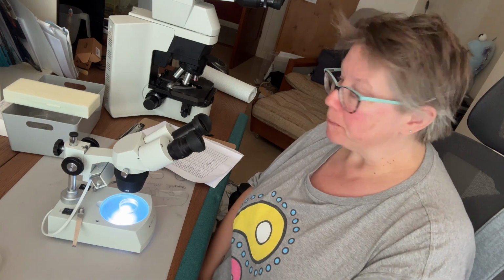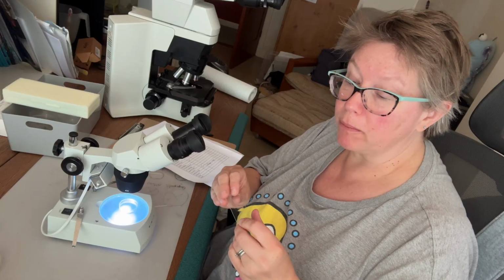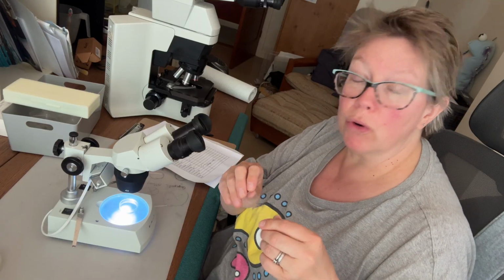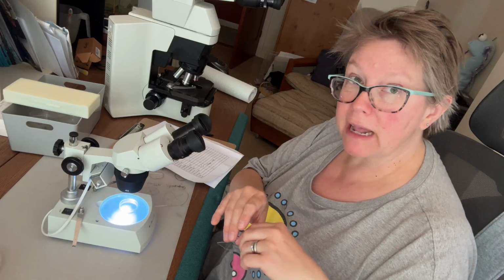If you have a higher powered microscope, you might choose to select some organisms or perhaps just a random sample from your petri dish. Pop them on a slide. So for the larger zooplankton, I suggest using a well slide or a concave slide. And for smaller organisms like phytoplankton, ciliates and foraminifera, you might want to use a flat slide.